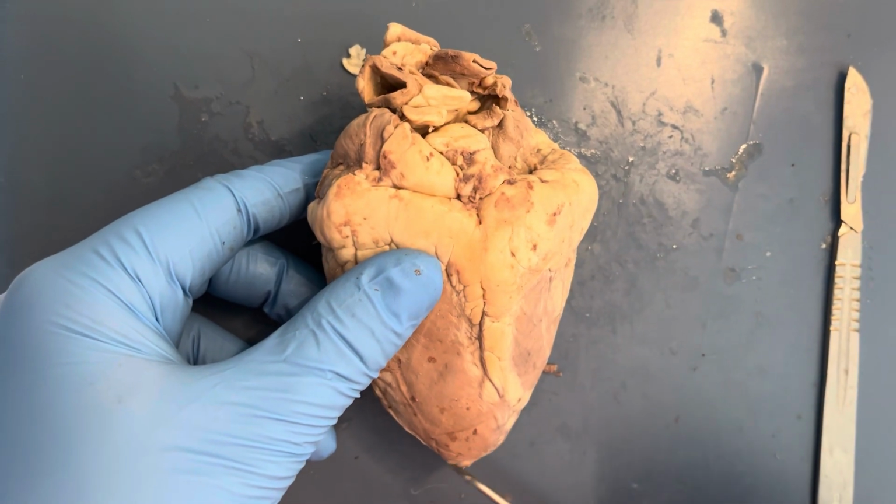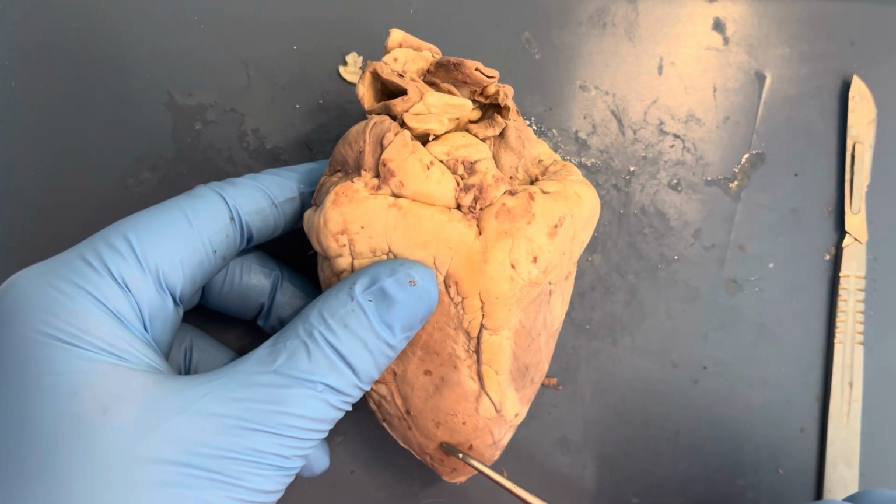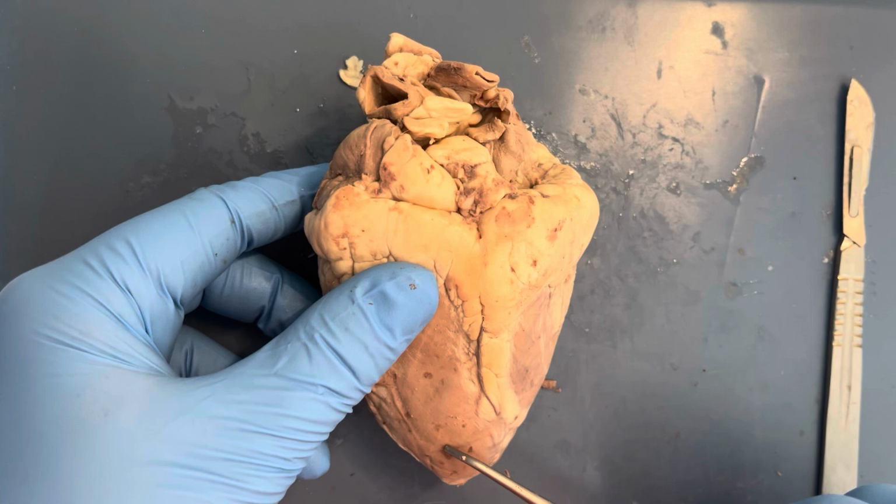On the bottom of the heart, we have the apex, which also maintains the structure of the heart. Its shape is this way because it sits below the two ventricles and creates a structure that allows for all the blood to pool all the way at the bottom of the ventricles when they are filled.